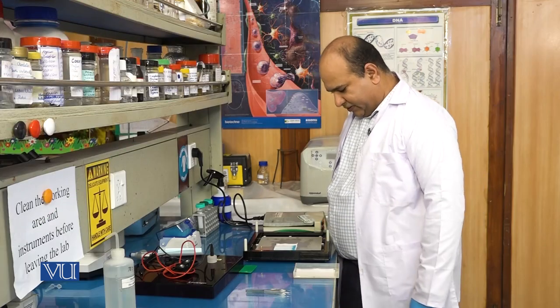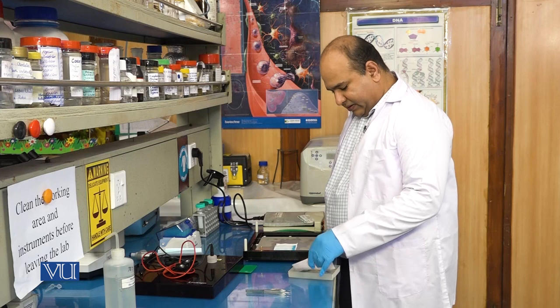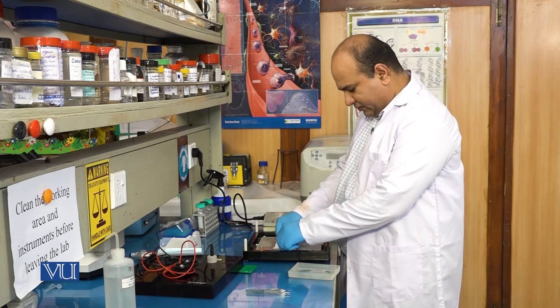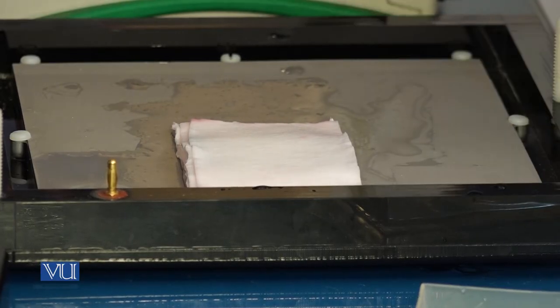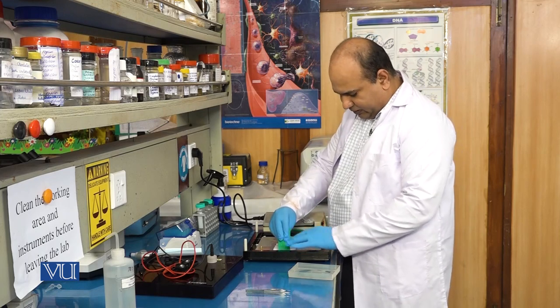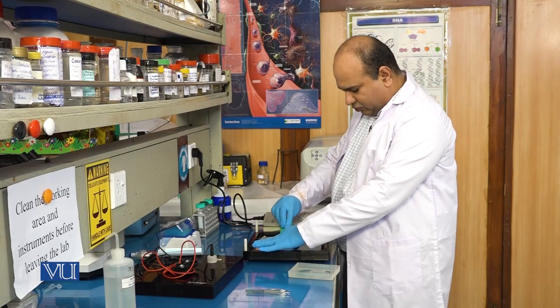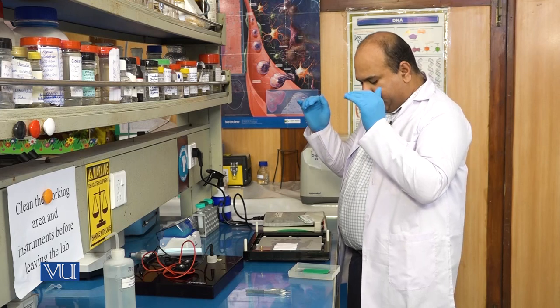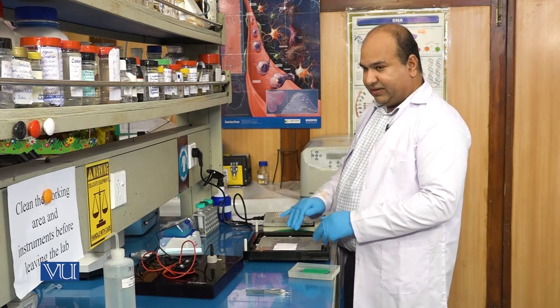Here is our gel which contains our proteins. Now we will add some filter papers above it. These filter papers are well soaked in the transfer buffer. We will place them over it like this, and any presence of a bubble here has to be removed. No bubble should be there because if a bubble is there the current flow will be interfered. We just press to take out any bubble. Now we have the lowermost layer of filter papers, then there is a membrane, then there is the gel, and above the gel again there are filter papers.